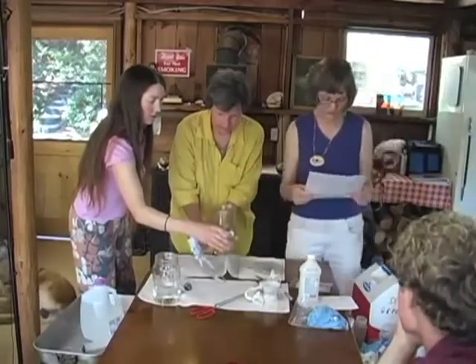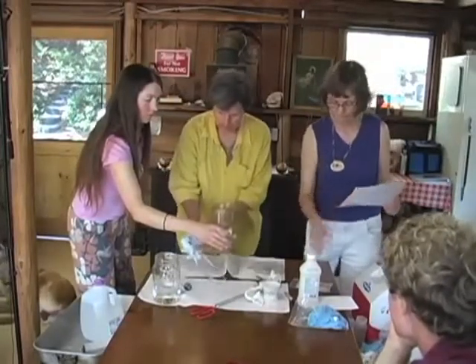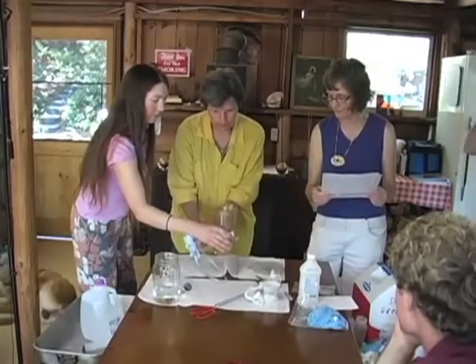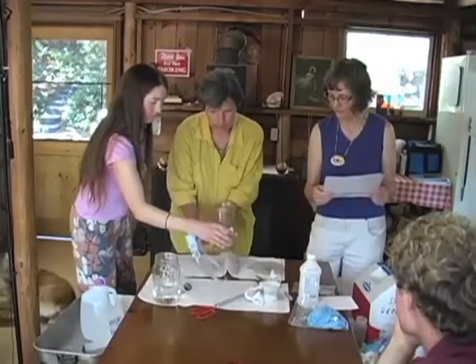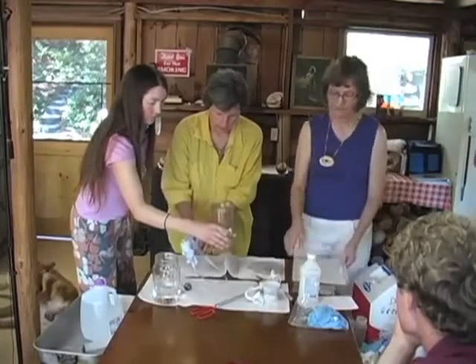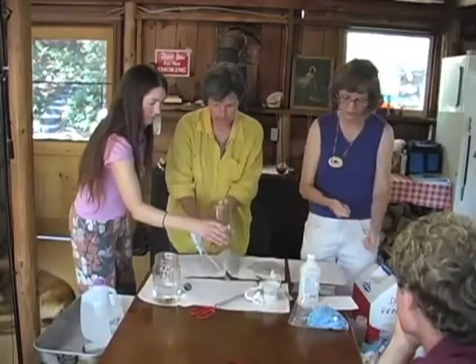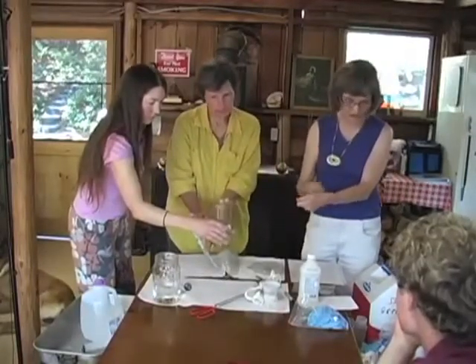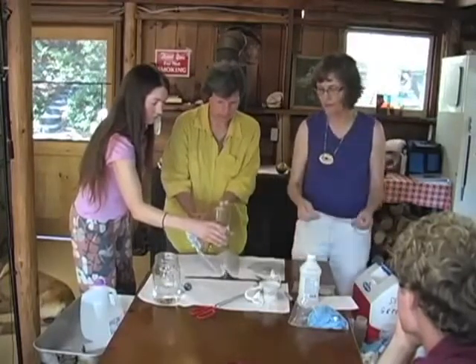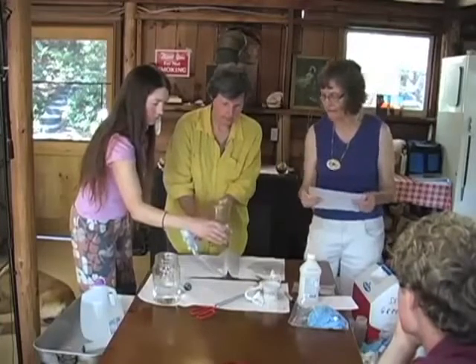Another way that we sometimes do it is we'll rinse the side. These pumps are really nice, they're a little expensive for our program, but before the students were using syringes and it took forever, you know, to create the vacuum to draw it through. It's a luxury, believe me. Saves lots of time. Now we're getting there.